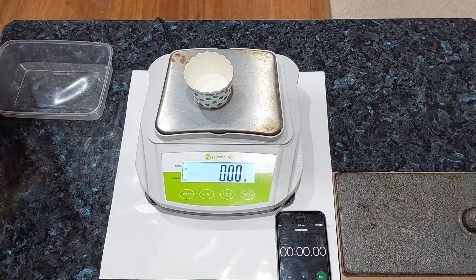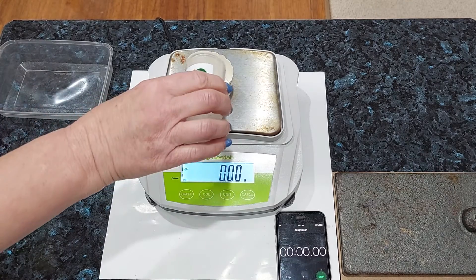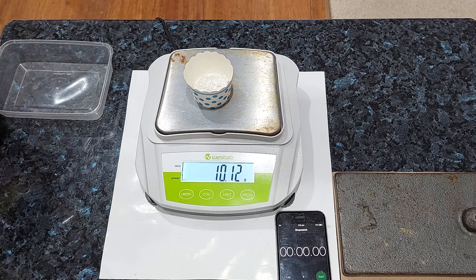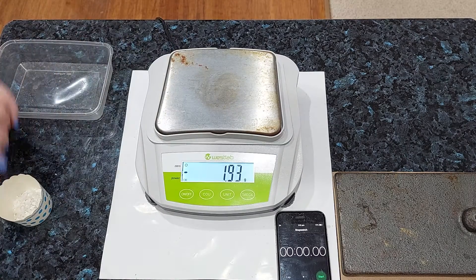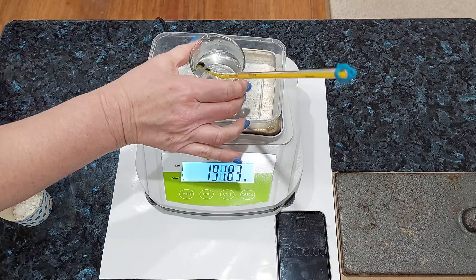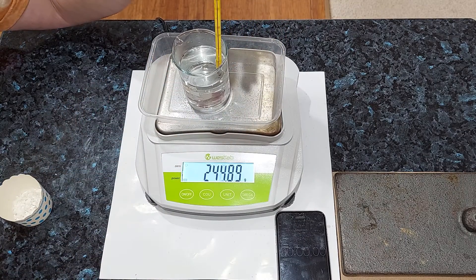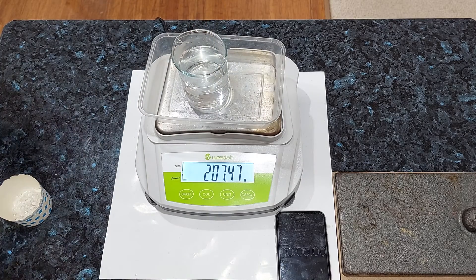And finally, the acid that's been in the hot water. Let's weigh out our marble chips — 10.12 grams this time. That's what we're going to add to our starting mass. Balance protector on. Our acid temperature is 38 degrees Celsius, so write that down — 38 degrees Celsius.